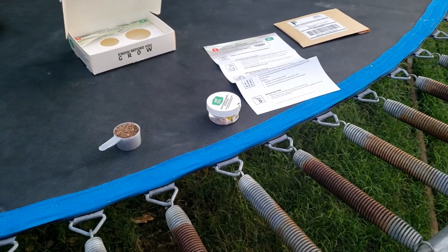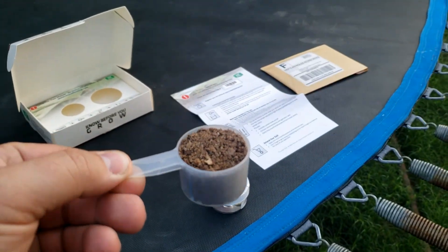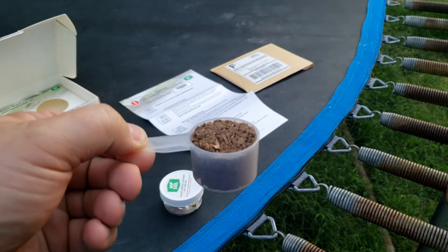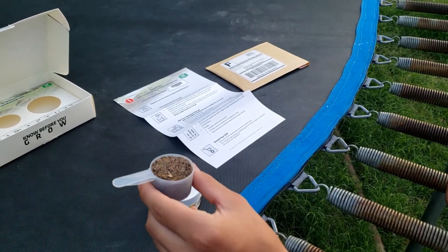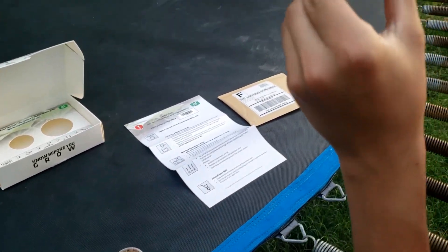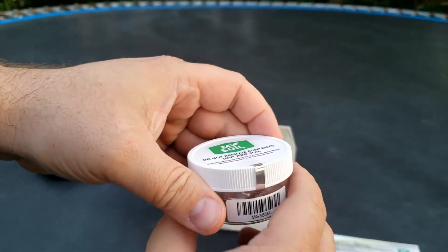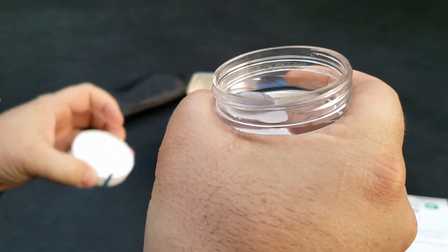All right, let's go over here and get our scoop. We've already gotten registered and we'll show you how to do that in this video as well. We're now going to pour — it's a good sampling of every area of our yard, because as much as I wanted just the native soil, we also needed a good idea of what our wood chips have been doing over the past six years. I'm just going to open this up really carefully, not to spill the water. All right, I broke the seal — maybe that's what they wanted. It says to be careful not to spill any of that.